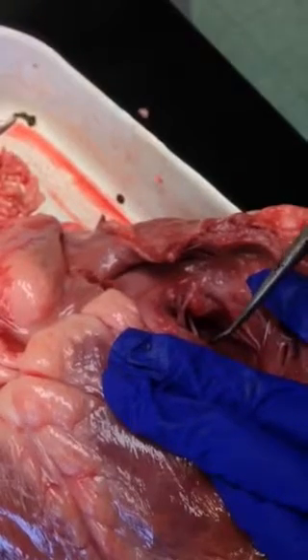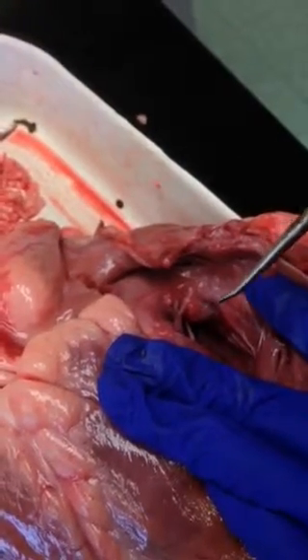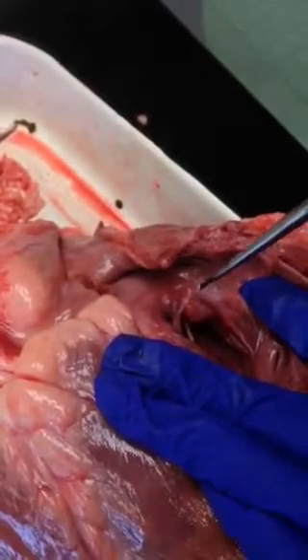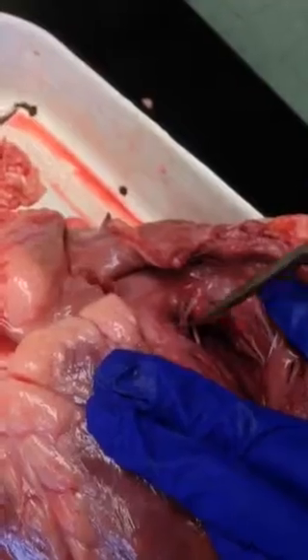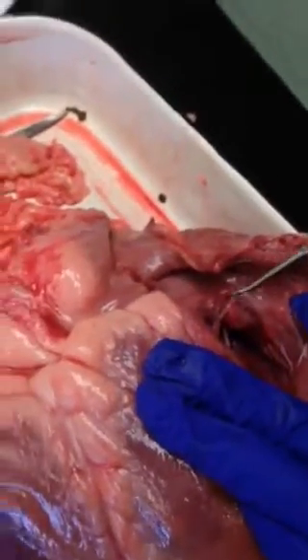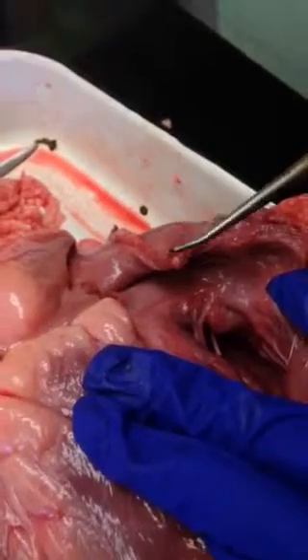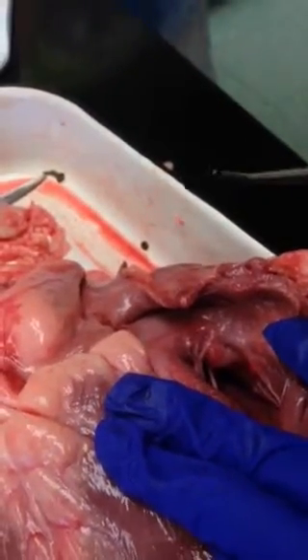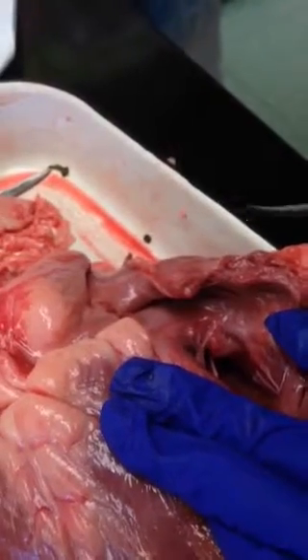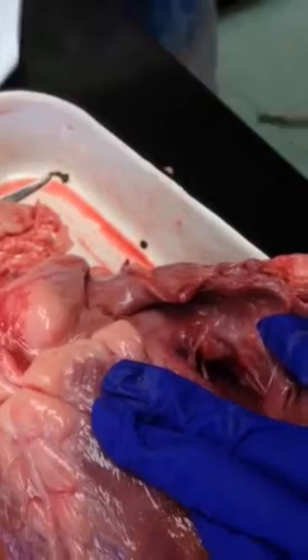The walls of the right atrium are relatively thin, but have the ability to expand a lot. In fact, when the right atrium is not filled with blood, the right atrium actually looks somewhat deflated and wrinkled, which you can see by the texture of the right atrium here. Now, the structure clearly relates to function because the atrium's ability to expand in size reflects its ability to hold a lot of blood and then contract. And the thin walls are conducive to expanding and contracting as well.